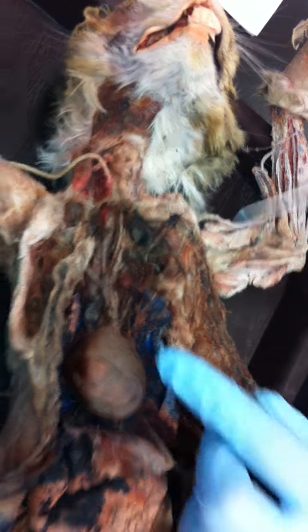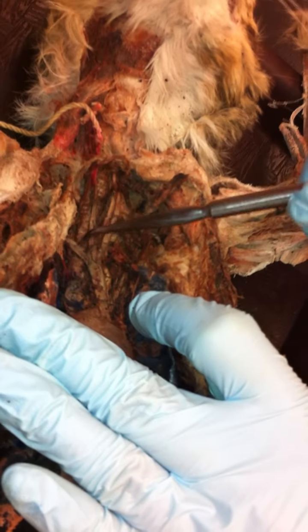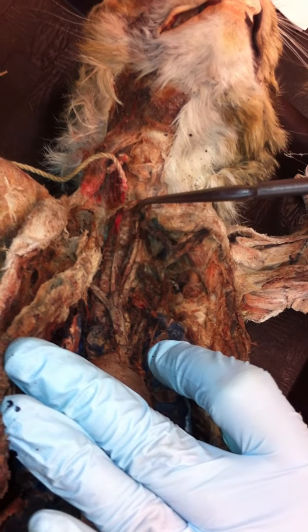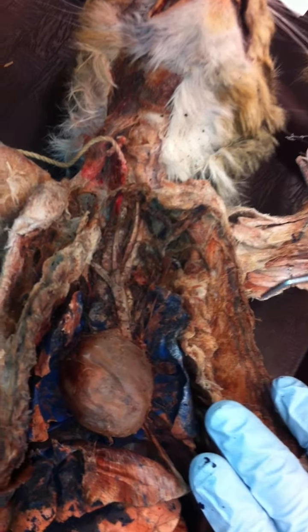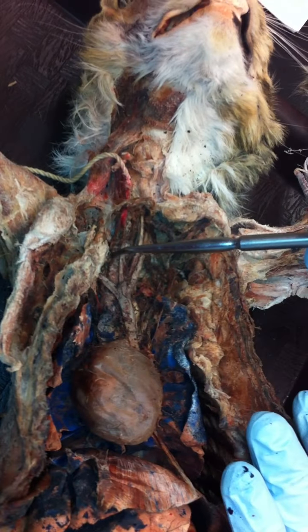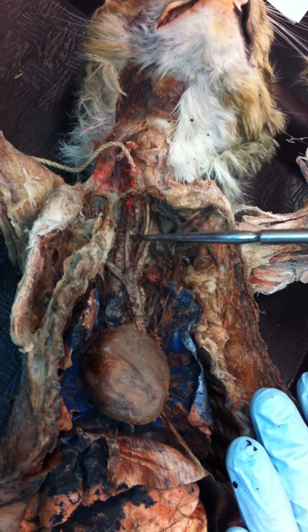Now on to the organs and such. I'll just do one right up here. This is the trachea here. Okay? Alright, so that leads right to your lungs, which you can kind of see there. The trachea is right behind the arteries right there? Yeah. Okay. Right? You can see the rings of cartilage. Okay?